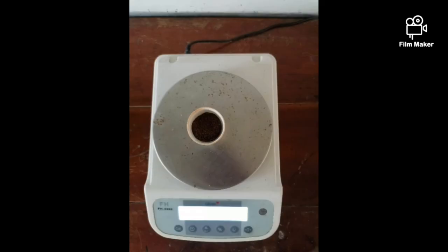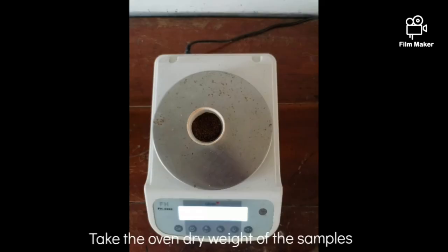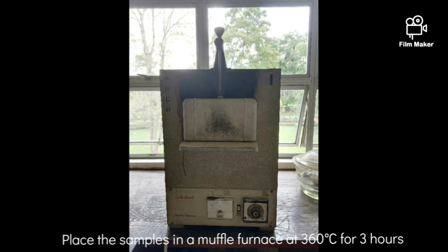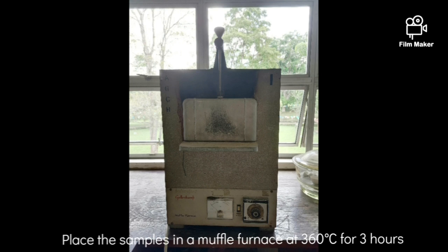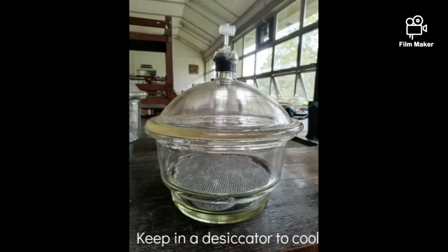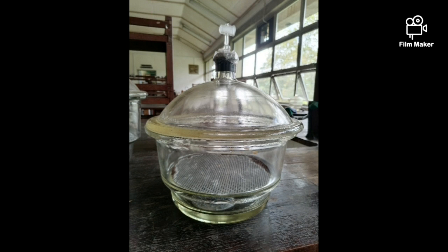Afterwards, take the oven-dried weight of the soil samples. Then place them again in the muffle furnace at 360 degrees Celsius for 3 hours. This process will remove the organic matter from the soil samples. Now keep the crucibles in a desiccator to reach room temperature, then get the weights of the samples.